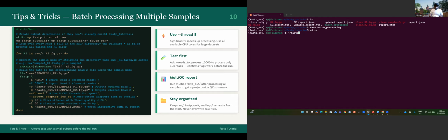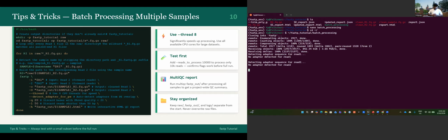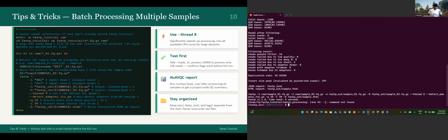This is in the home fastp. It is in fastp tutorial, and the script name is batch, something like this. If I run that, it should create the directory that I mentioned in the script and do the same analysis. Let's see. I hope it doesn't fail because I didn't test that before the tutorial. Okay, it's cloning, it's working. Cross fingers. Voila, it worked. That's nice.